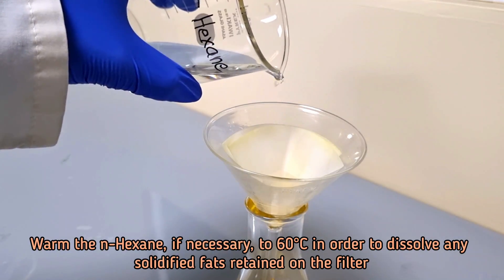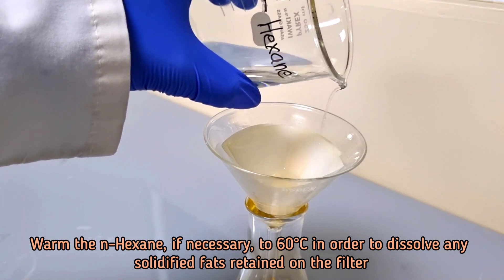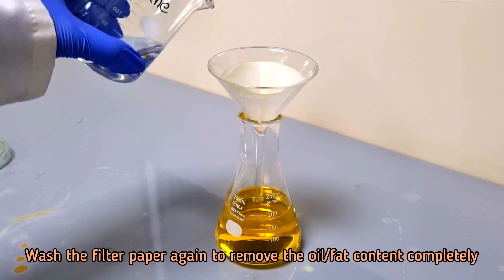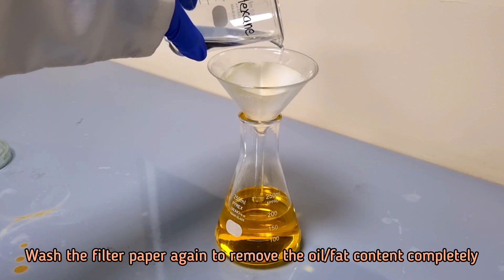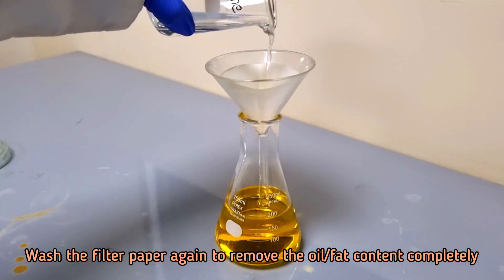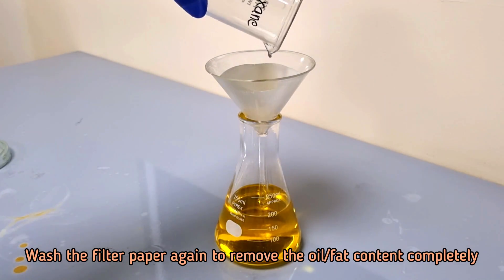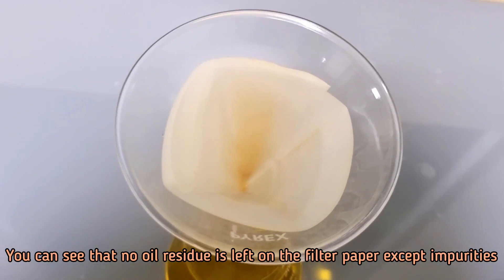Warm the hexane if necessary to 60 degrees Celsius in order to dissolve any solidified fats retained on the filter paper. Rinse the filter paper again to remove the oil or fat content completely. You can see that no oil residue is left on the filter paper.